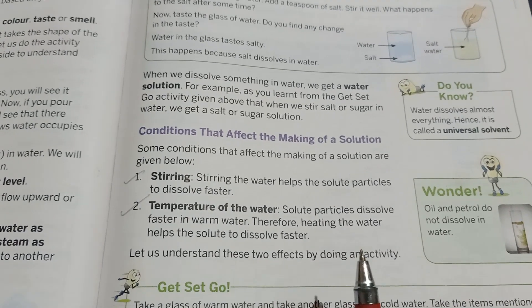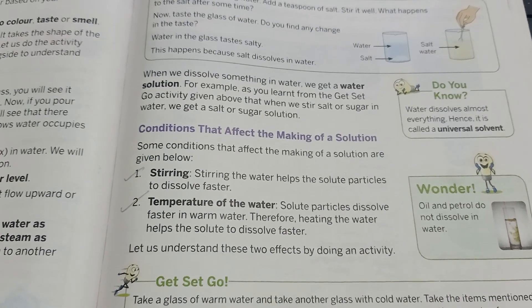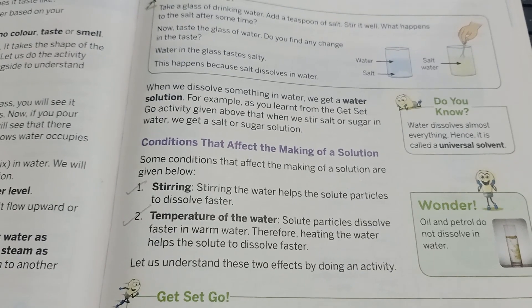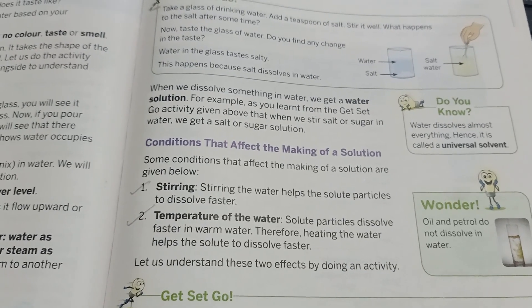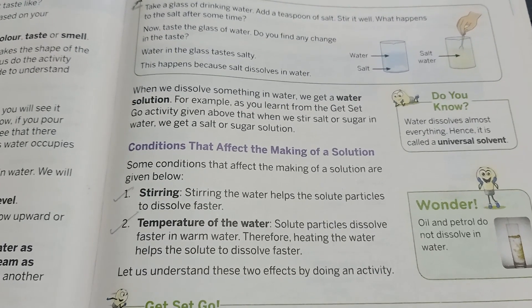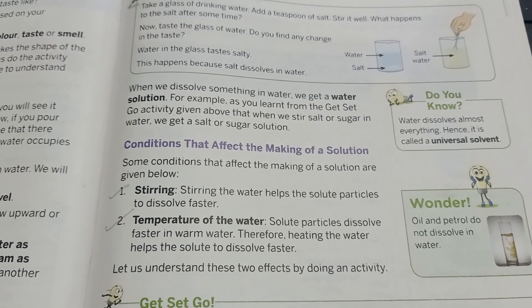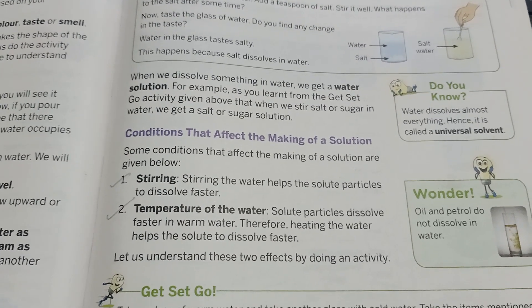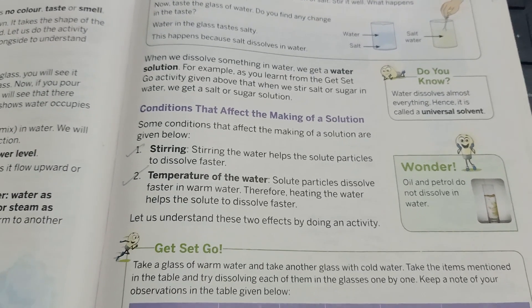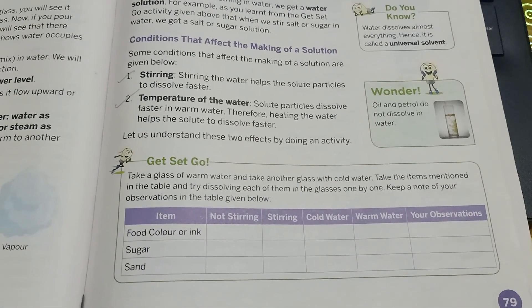Now, in order to understand these two conditions and increase the effect of making a solution, we will do one small experiment, and that experiment will be your today's task.